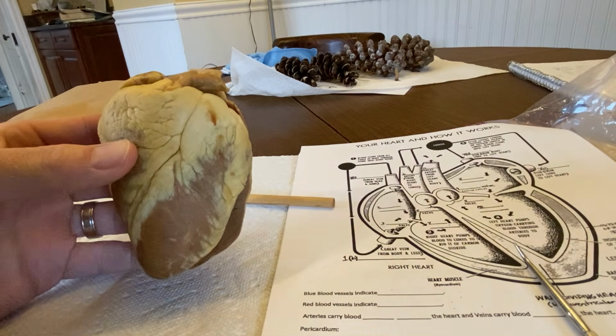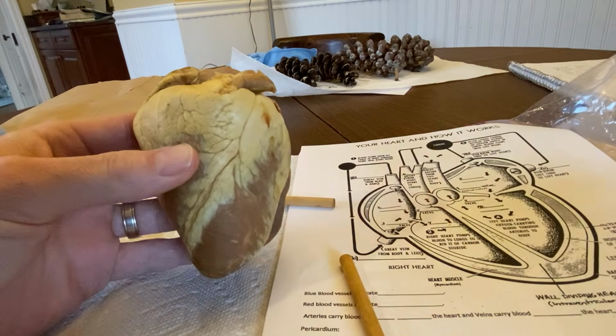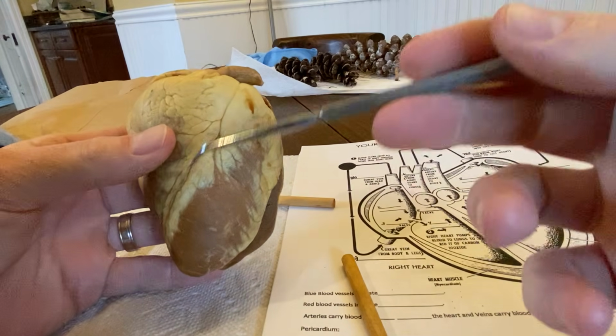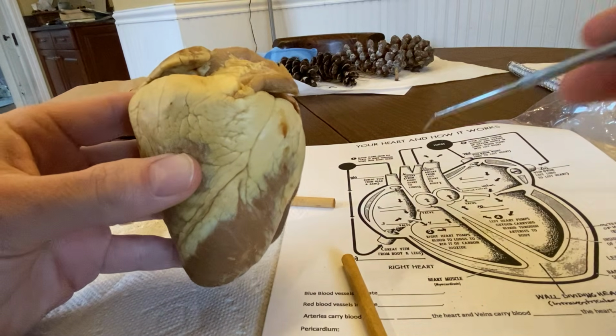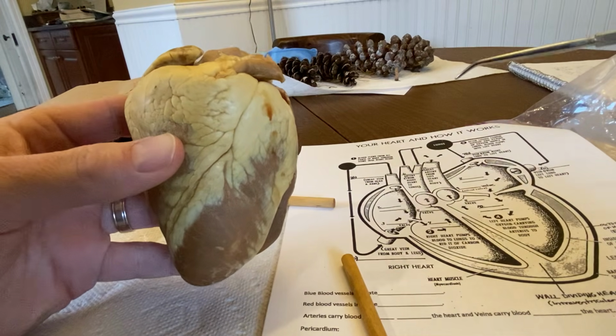All right, guys, so since we do not get to do our heart dissection in class this year, I thought I'd do a quick video of it and run through the major pieces. We're going to first start with the external anatomy, then we'll talk about what's on the inside, we'll talk about the major blood vessels that attach up top here, and then we'll also review the path of the blood as well as how the heart beats. So it should work out pretty well for us, okay?